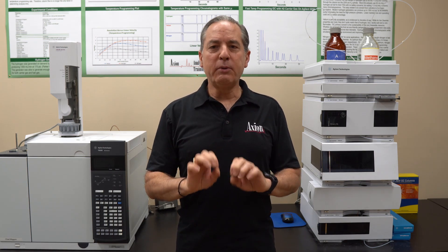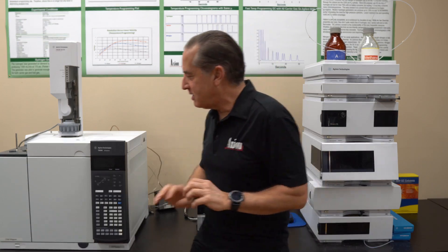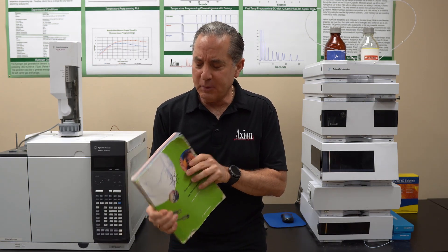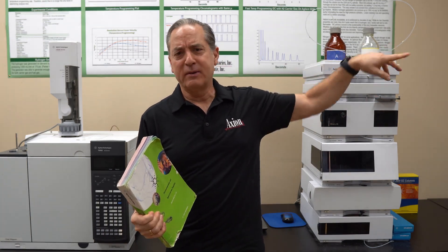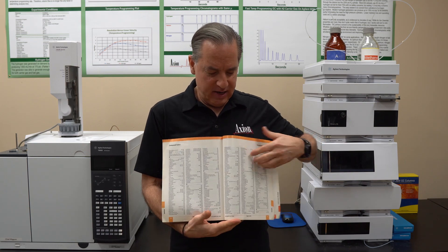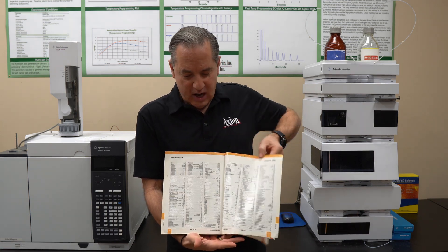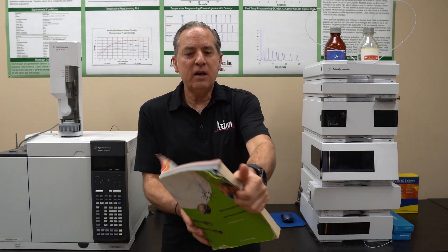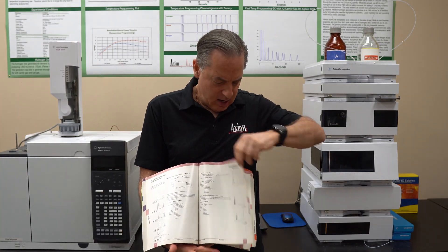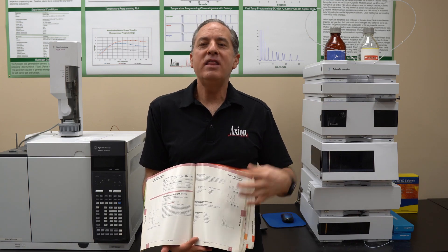Step one: look in a column catalog. This is the best thing to do. I keep collecting paper catalogs — I have my Agilent catalog, my Waters catalog, my Phenomenex catalog on the shelves. In the back of every catalog you'll find a section called the compound index — a list of every chemical they have separated. Find the application you want, turn to the page, and it gives you the column length, diameter, particle size, stationary phase, temperature, flow rate — everything has been done for you.